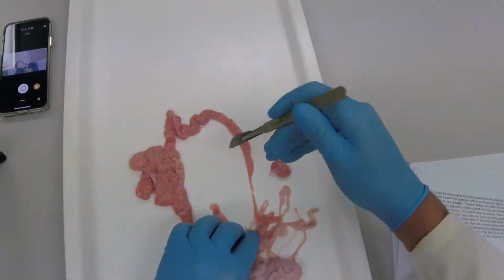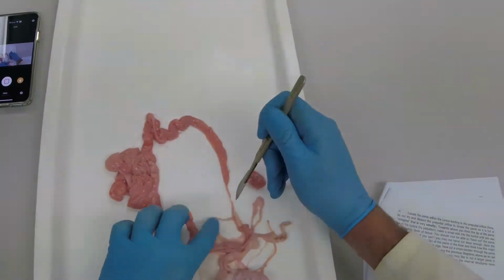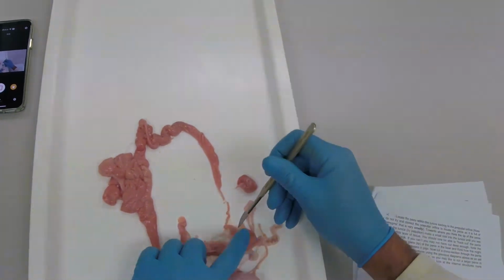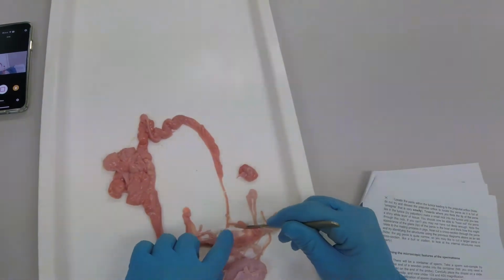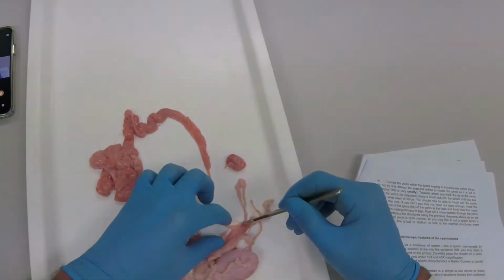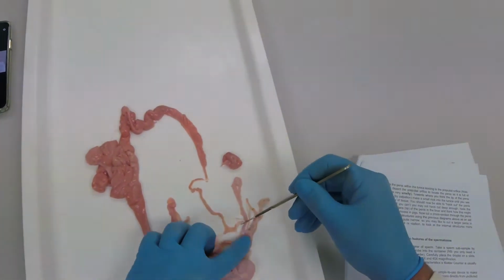The oviduct now. Now the oviduct has three regions: the isthmus near the uterotubule junction, the ampulla region, and the infundibulum, which is next to the ovary. So in pigs and a lot of other species, fertilization occurs in the ampulla region of the oviduct. So this is where the egg and the sperm meet. Just teasing out towards the infundibulum region of the oviduct now, which is the start of that bursa or fimbria, which usually wraps around the actual ovary itself.